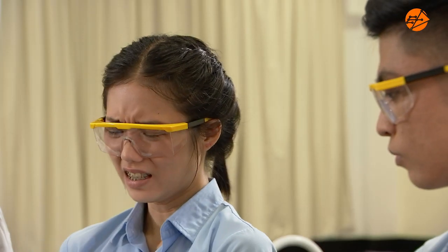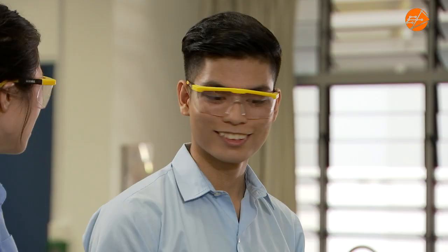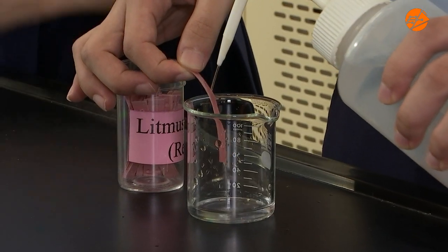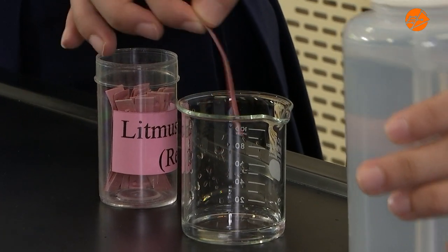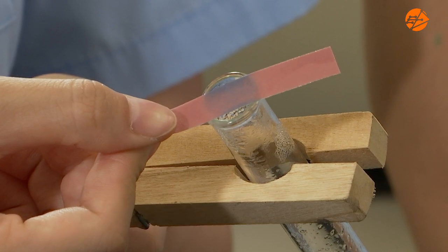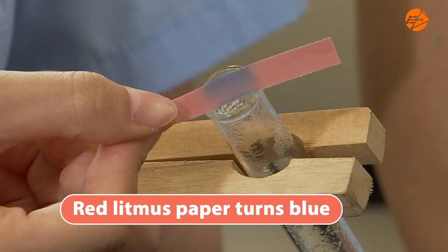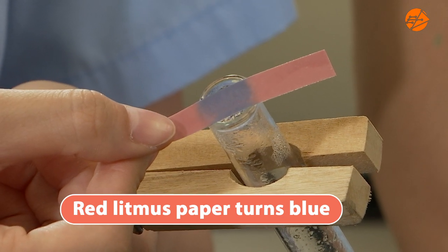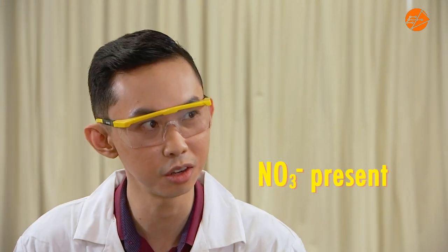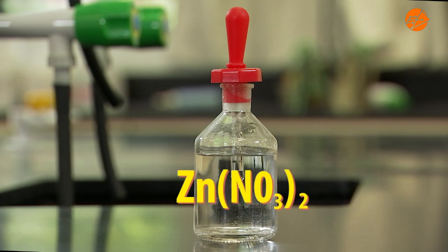It's that pungent smell. We should test it with moist red litmus paper. The red litmus paper has turned blue. This confirms that ammonia was evolved and that nitrate ions were present in the solution. This confirms the identity of the solution in the bottle, and it is indeed zinc nitrate.